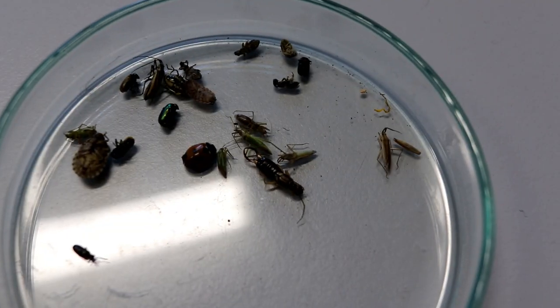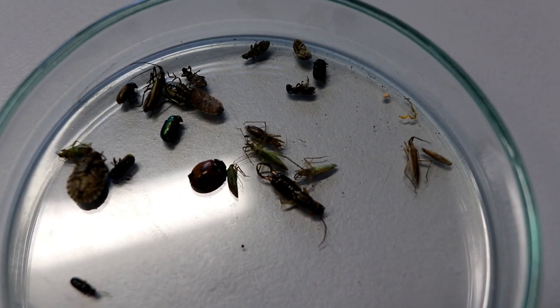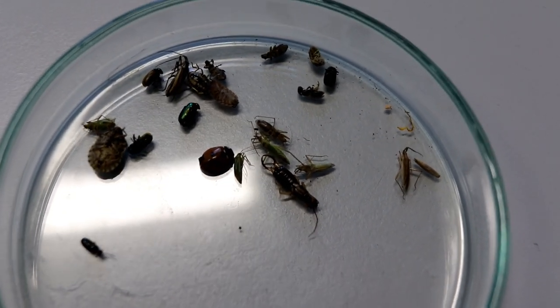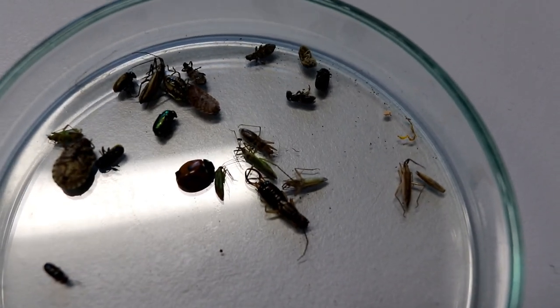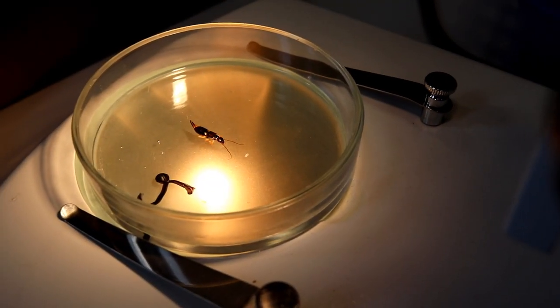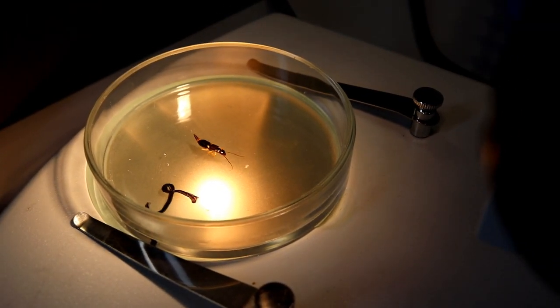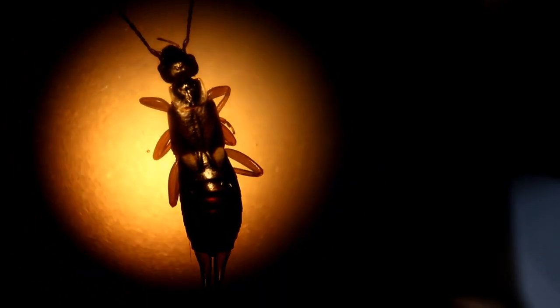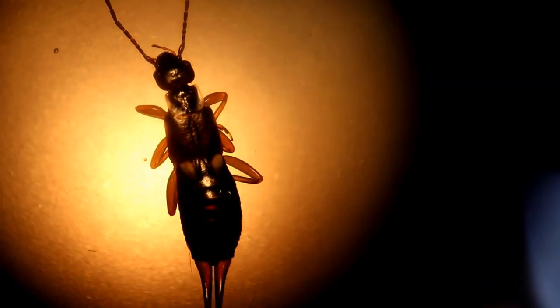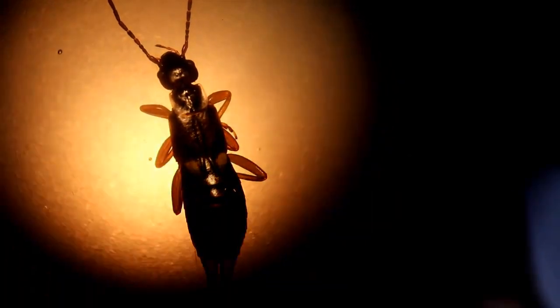Back in the school laboratory, we basically sorted through the insects again. We actually did not collect a lot of them — we were a little bit worried that we did not have enough insects. We placed the insects on a glass petri dish and put it under the stereo microscope. Here it is through the microscope, and the students had to do two things.